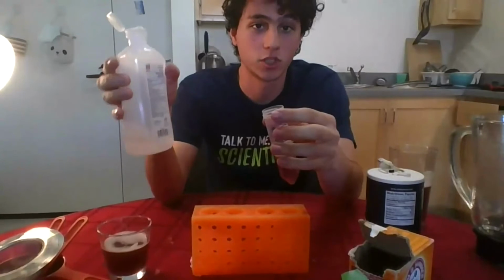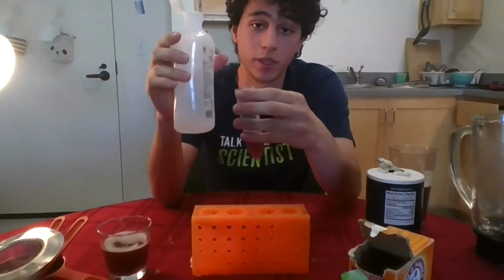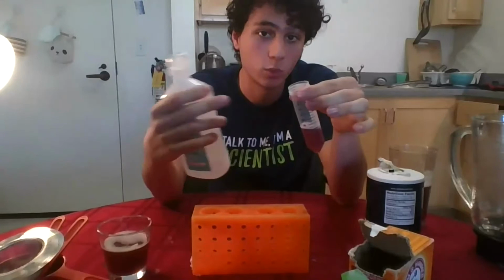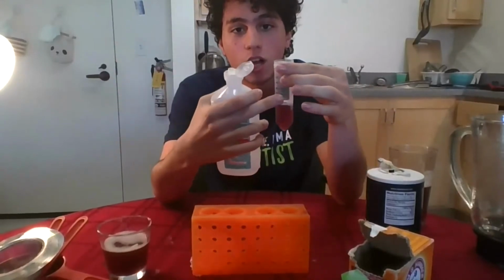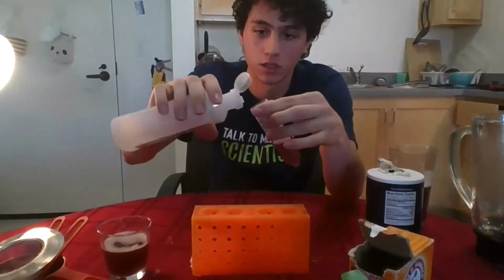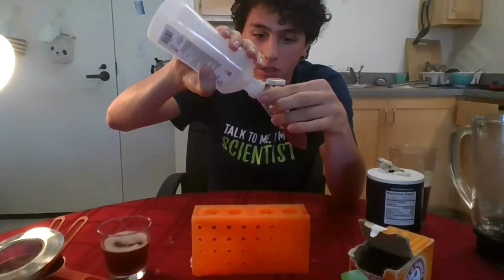And as Gabriela was talking about, you have to be very gentle on this step. You have to be very careful because if you do it vigorously, the alcohol can mix with the strawberry blend. So you gotta make sure that as the rubbing alcohol goes down, it goes down against the wall of the test tube or the glass or whatever container you're using. If you do it that way, then it will just settle on the top of the strawberry blend and it will not mix. And that's exactly what you want. You want two different layers. So very slowly and carefully, I am adding the alcohol. Like so.